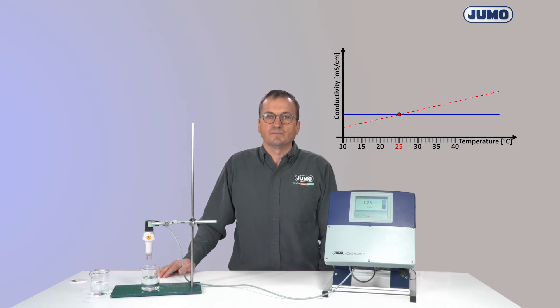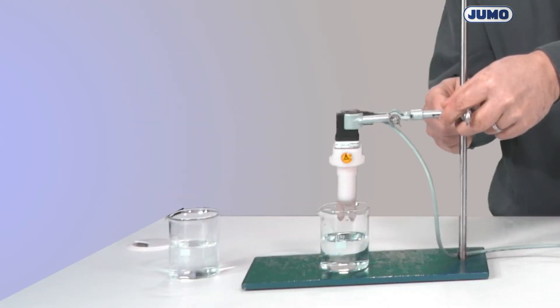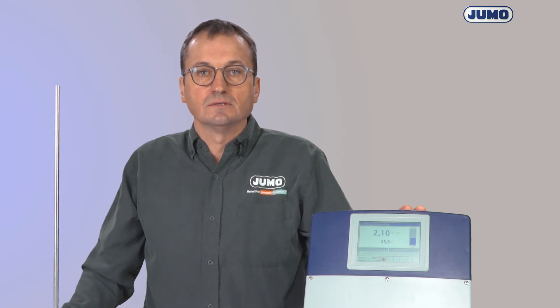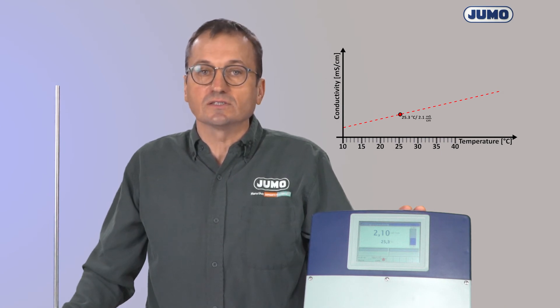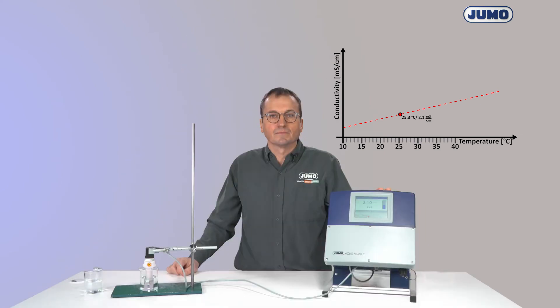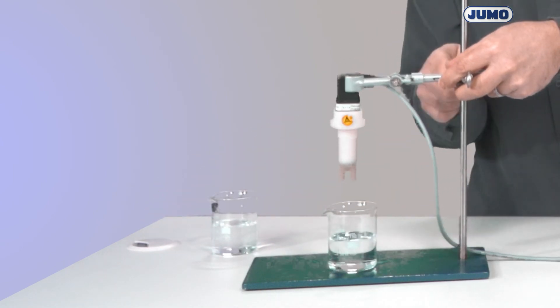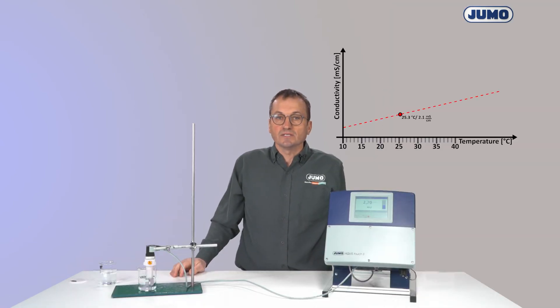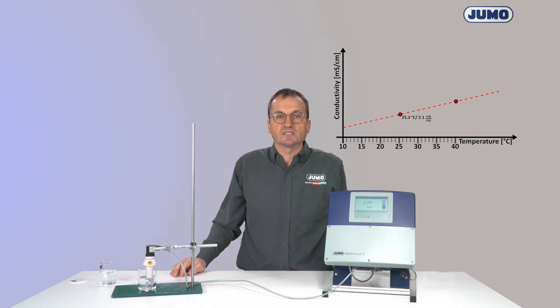This is the compensated conductivity, which is usually displayed on the transmitter. Now I place the sensor in the beaker containing the process solution with around 25 centigrades and I determine the uncompensated conductivity, waiting until the end value of the temperature is displayed. The temperature is approximately 25.3 centigrades and at this temperature the uncompensated conductivity is 2.1 mS per centimeter. Then I place the sensor in the measurement solution with the working temperature.